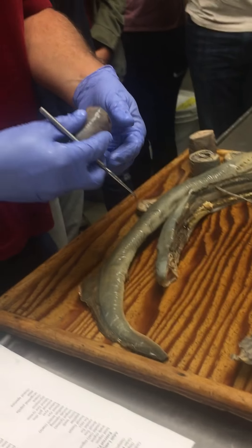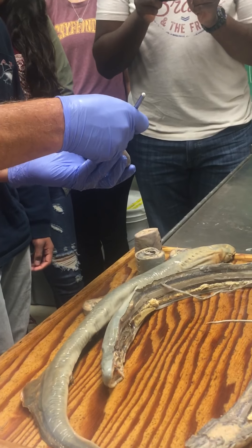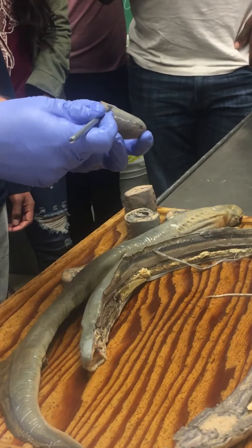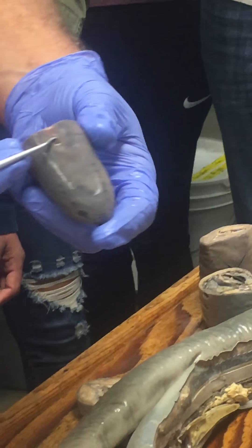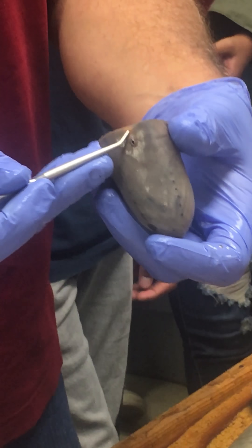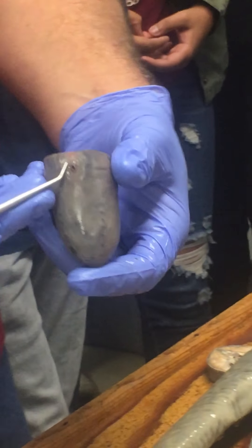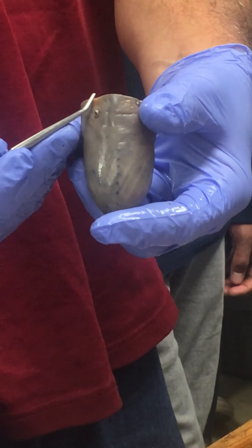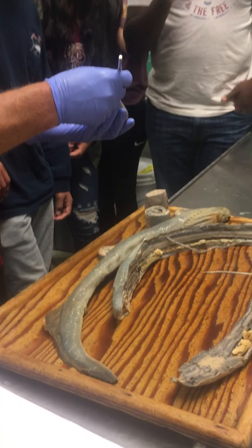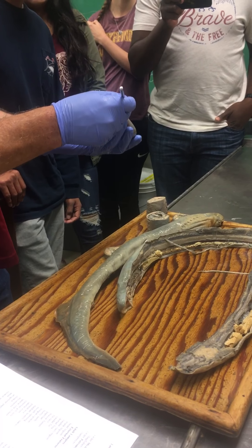On the outside, top of the head, is this hole right there — the nostril. And it's in the middle so it's called the median nostril. Right behind it, not showing up super great on this particular specimen, is a more lightly pigmented area right there.